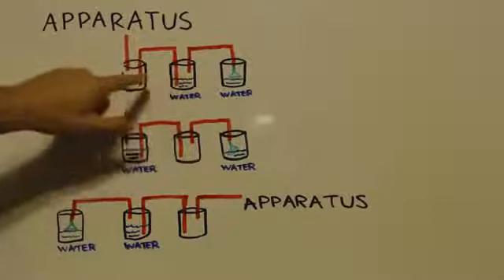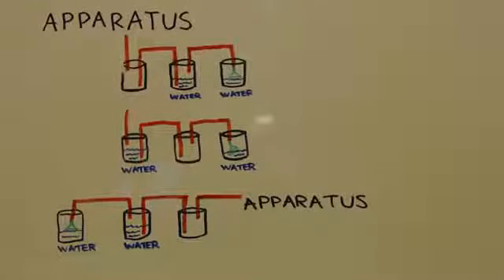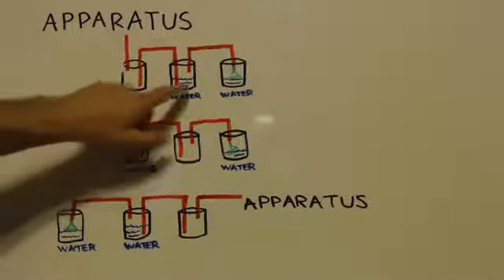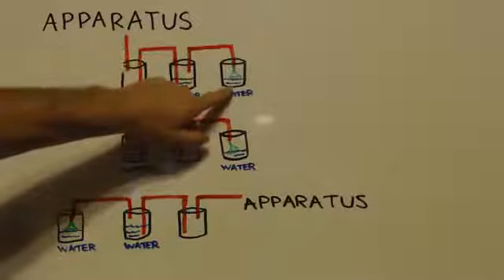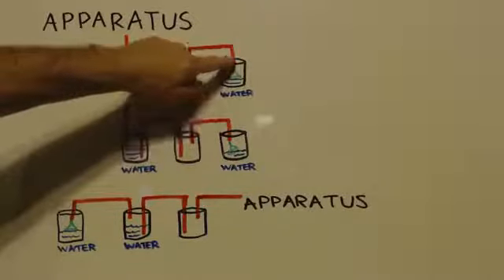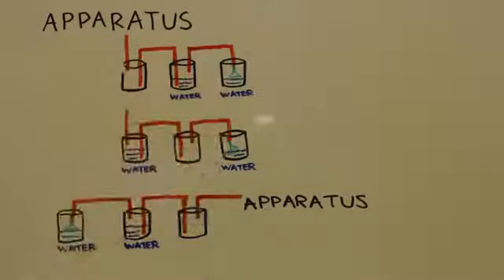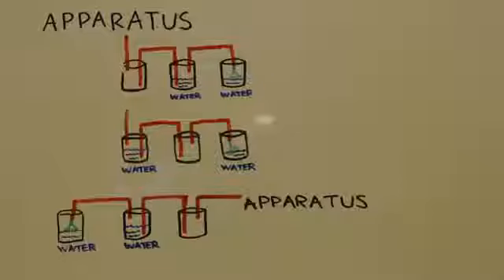And you can see it's only enough to fill it up halfway, and we only put our hose just barely into the canister. So let's say there is a suck back. The water comes out, comes into here. This water will go up into the funnel, but as soon as it gets partway up the funnel, this water level will go down below the funnel. And air will be allowed to go into the funnel, into the apparatus, that way equalizing the pressure. And that will stop the vacuum from here.